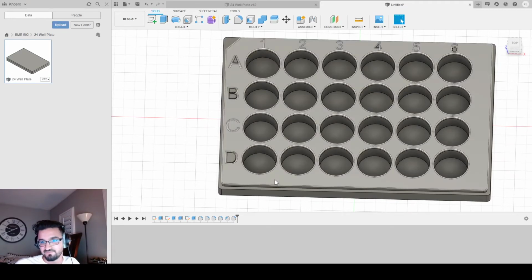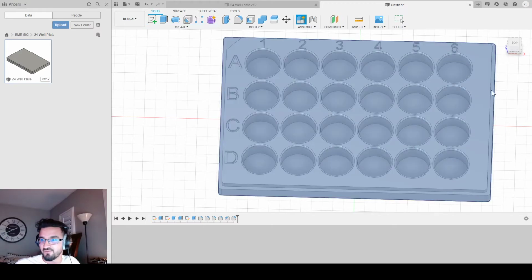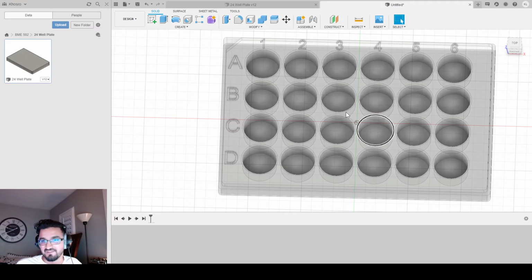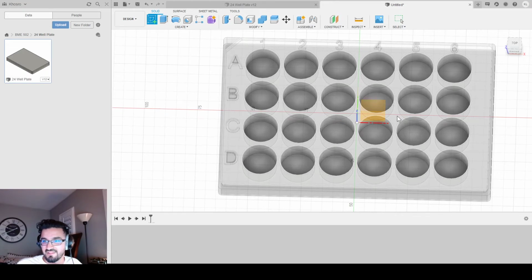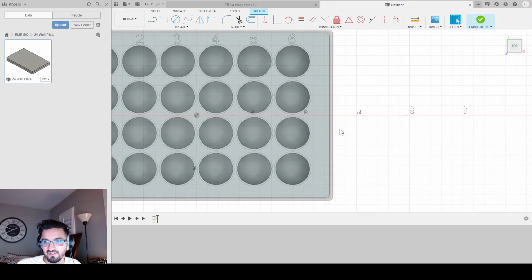Now let's make the lid. So what do we do? First go to create and make another new component. And this is going to be your lid. I don't know why I went all capital, but whatever, we're going to keep it. So you'll see that this gets grayed out. Don't freak out. It's okay. Go to create sketch. Select the top of your plate. Make sure you're not at the wells. Just make sure you're at the top of the plate. I would just select this corner here. And that's where you're going to start, right?